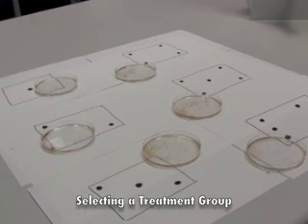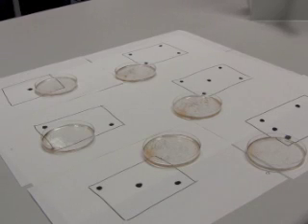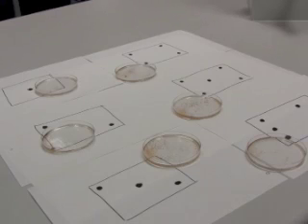To choose which treatment group you will be examining, you should roll a dice as represented here, one through six.